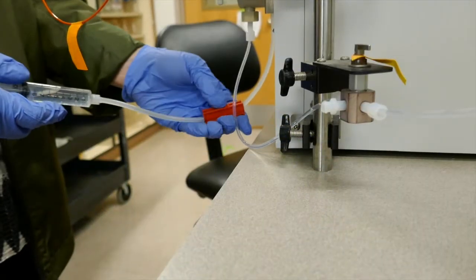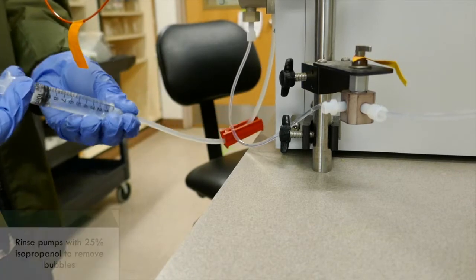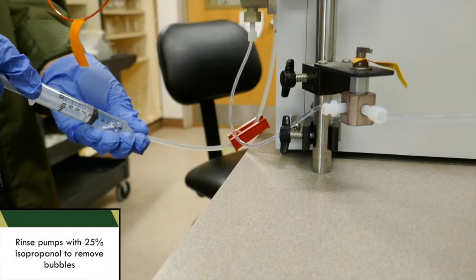Rinse the pumps with 25% isopropanol and that helps to remove any of the bubbles that we have on the lines.